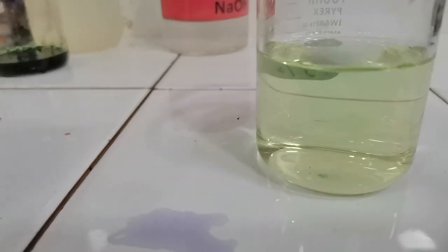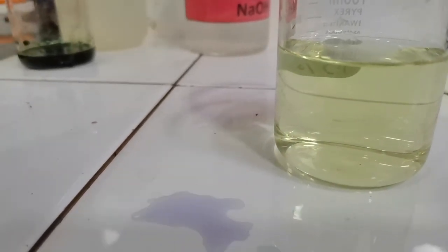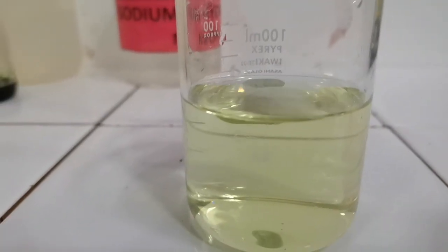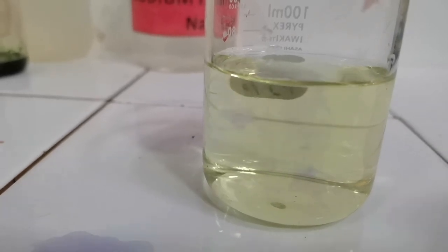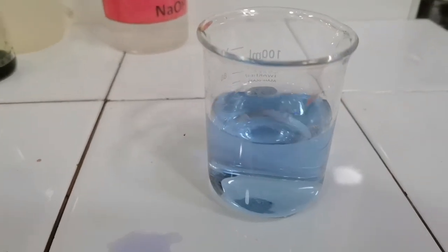green. That means the sodium hydroxide has neutralized the sulfuric acid present. So we add a little more to turn this basic. One drop added, we can see the blue color going around. A second drop, and then shaking the contents, and our solution finally turns blue.